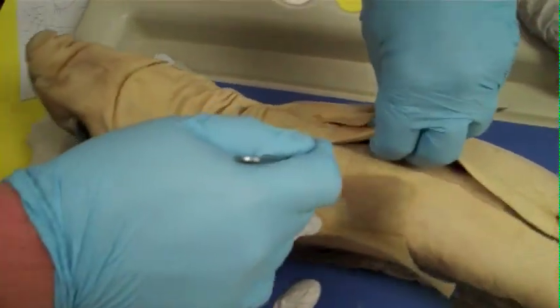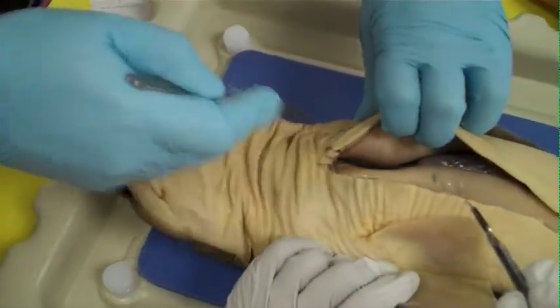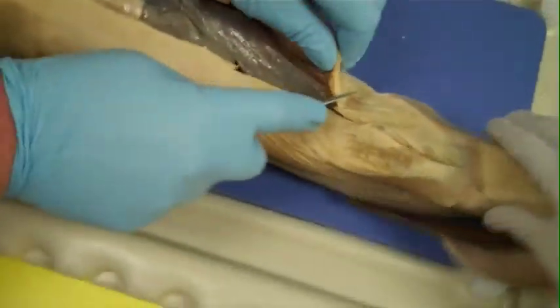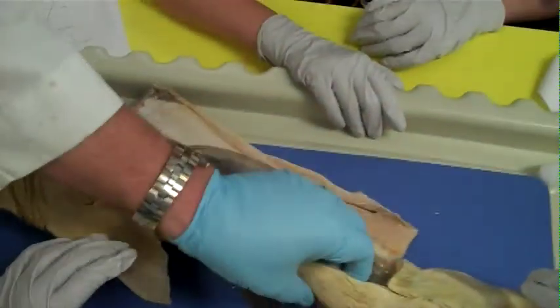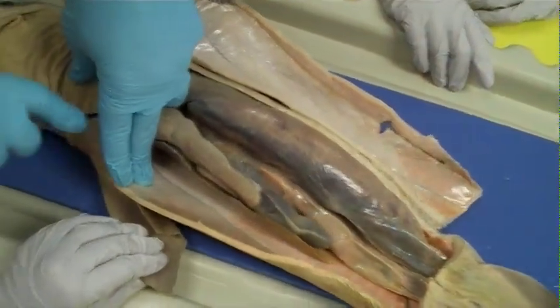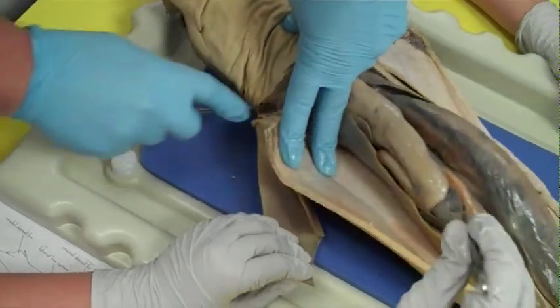And I'm going quick. I've dissected probably 500 to 1,000 sharks over the years. This blade has gone through a lot of shark skin — it's the same one I've been using since the beginning. But the blade does get duller over time.